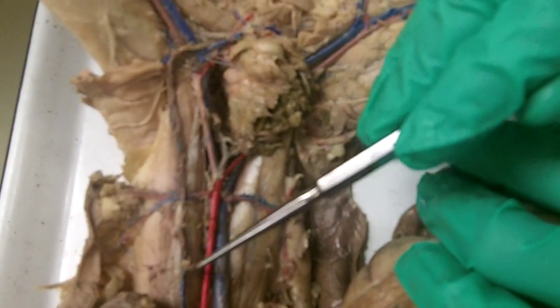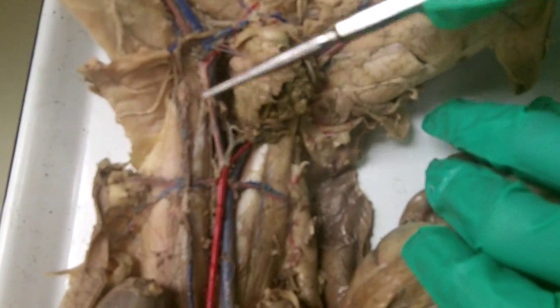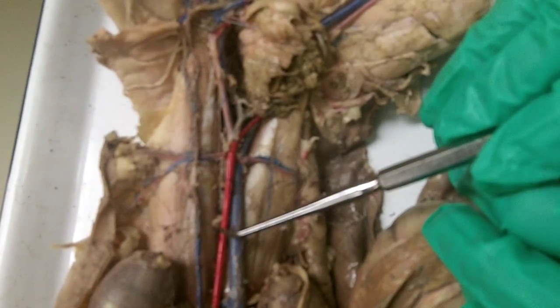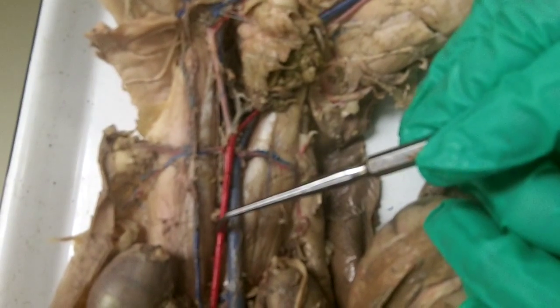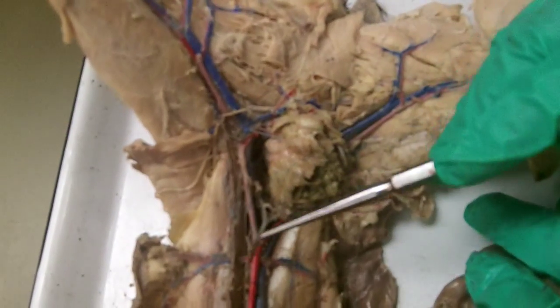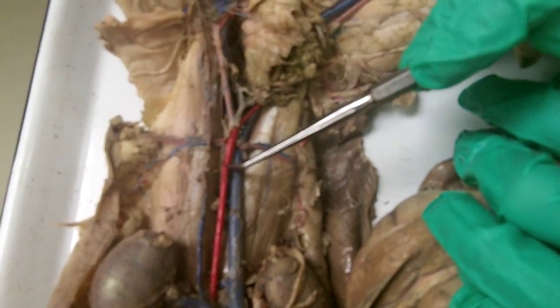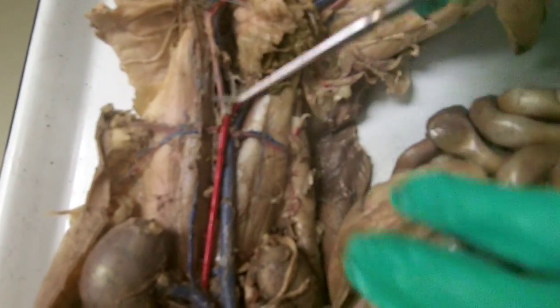And this is the renal vein, but also wrapped up in it, very tiny, very red, right there, is the gonadal artery. And it was coming off right here on the descending abdominal aorta. See the little nub right there where it got cut? So that's where the gonadal artery was coming off, and then together with the vein, it was traveling through the inguinal canal. The right gonadal artery is also severed on this side. The next vessel that comes off the descending abdominal aorta has also been ripped off.